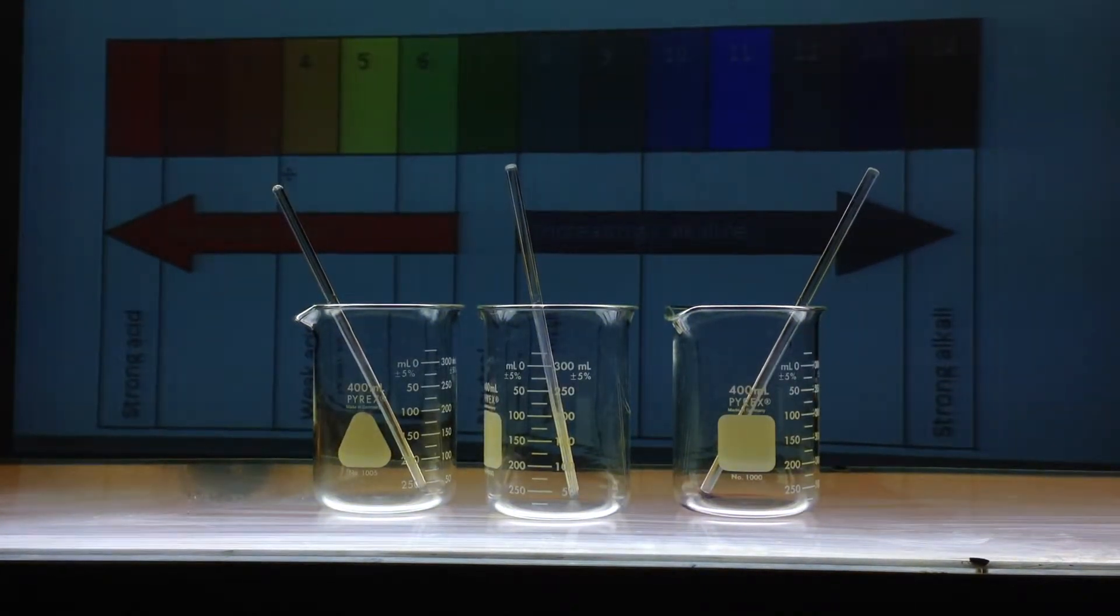In this demonstration, we're going to review how to determine whether a salt is acidic, basic, or neutral.